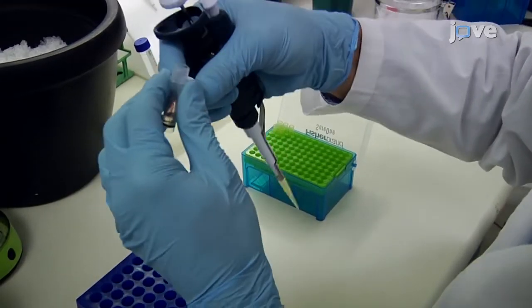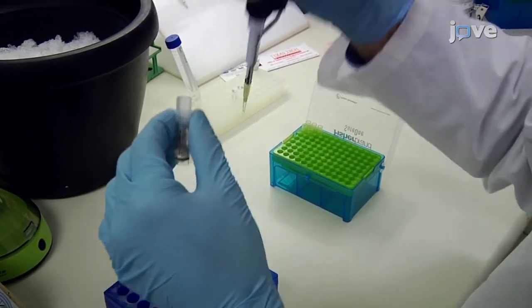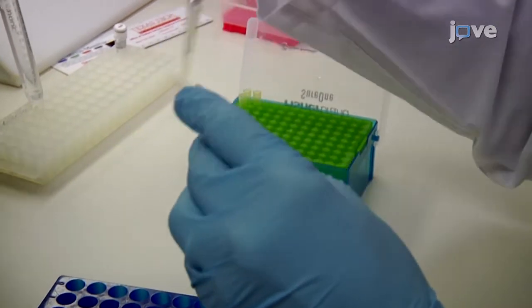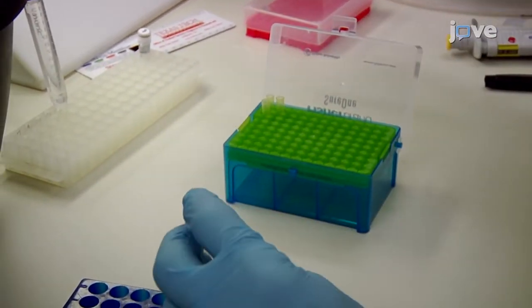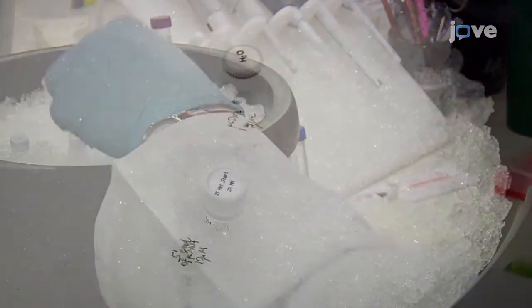Dilute the PCR primers to 10 micromolar in water or TE buffer. Then, dilute all the DNA templates and single-stranded synthetic DNAs for the PCRs to 1 nanogram per microliter in water.